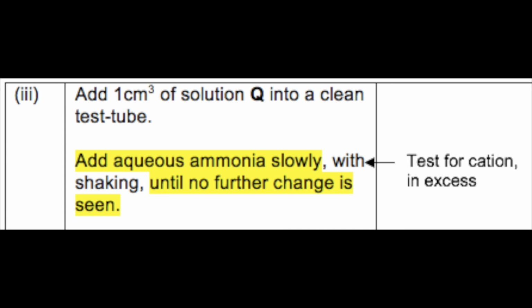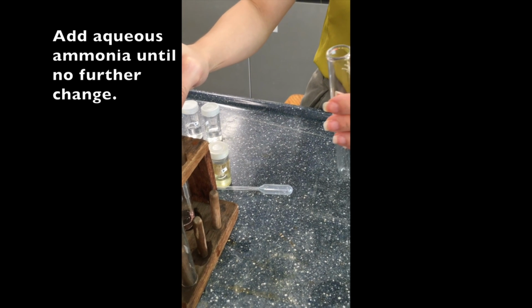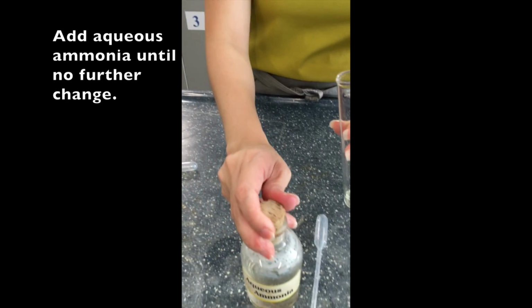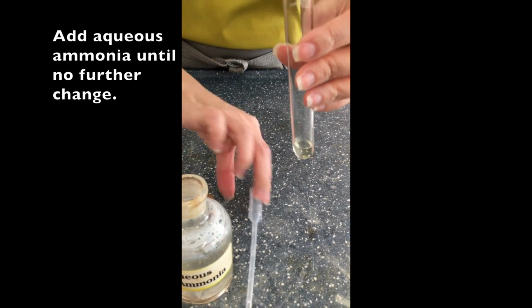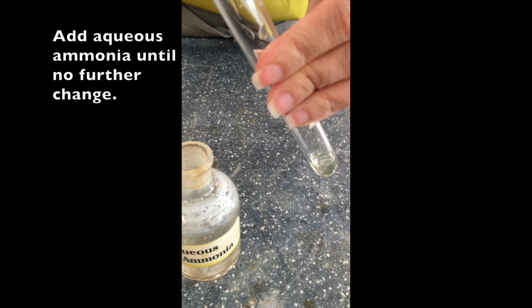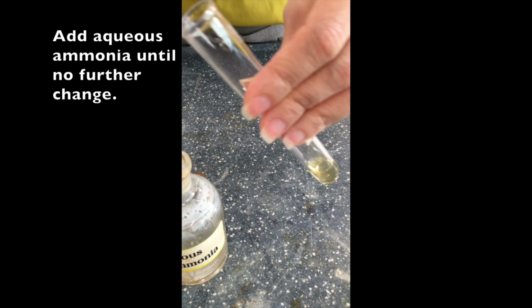So we want to add 1 cm3 of solution Q and we are adding aqueous ammonia, which is a test for cation, until no further change, therefore it is in excess. So we need to see if there's any precipitate produced and if it's soluble or insoluble in excess aqueous ammonia. So here we're transferring the pale pink solution Q into this test tube. Once we transfer it, it looks like it's colorless. Now we'll add aqueous ammonia. So we add a few drops first.